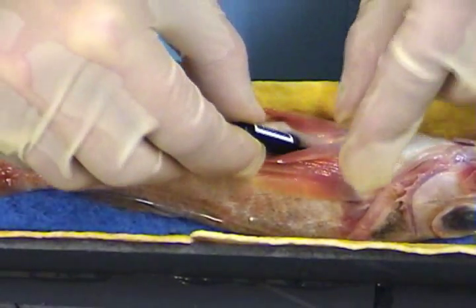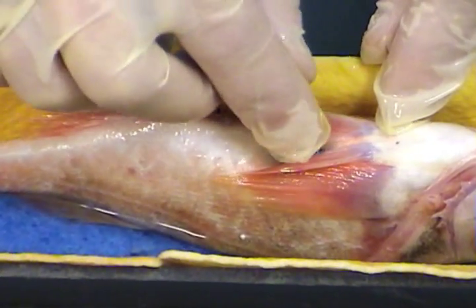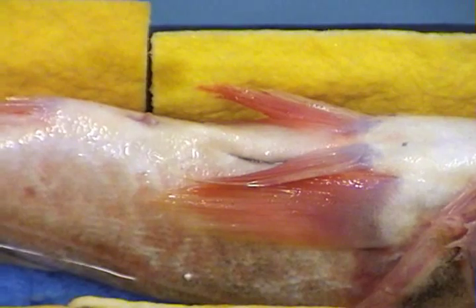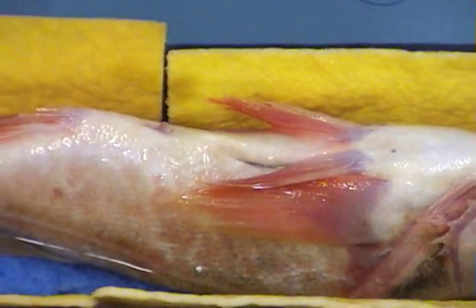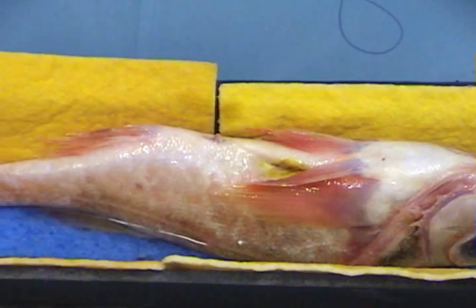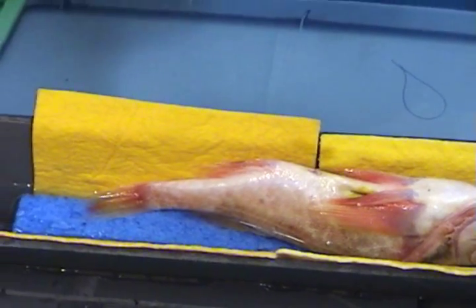Once you've finished, you can now insert the transmitter by gently pushing it through into the body cavity. It should feel very loose such that the tag can slip and slide around. This tells you that the tag will not be putting pressure on the internal organs and the body wall. I prefer to inject some tetracycline and antibiotic into the body cavity and around the incision area. Tetracycline is an antibiotic that stops the bacteria linked to the infection from growing by hindering or disrupting its use of proteins.